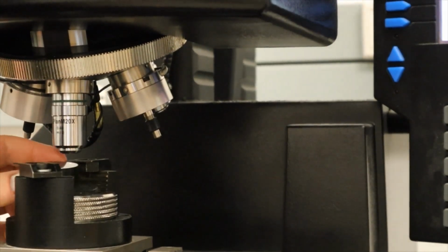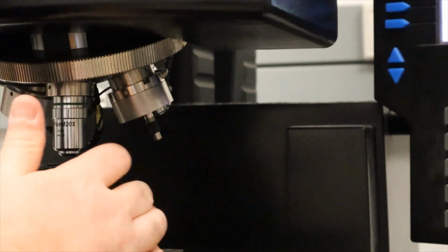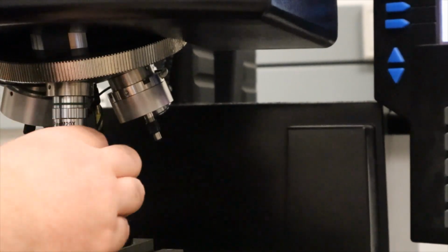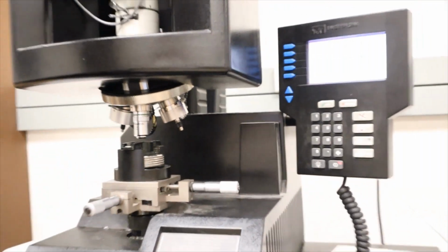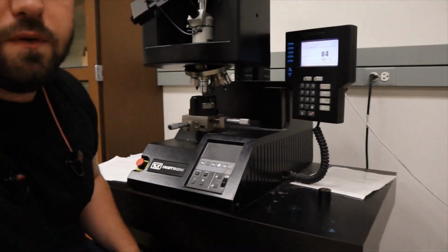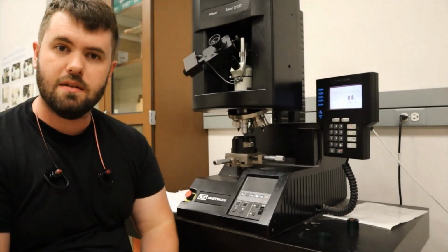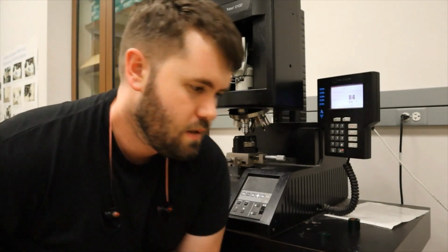Take our puck and we slide it in, and then we tighten our grips, we raise the stage, and now I'm going to move the stage up and down to get it in focus in the 20x objective, and then I'll switch to the Knoop indenter and perform the test.